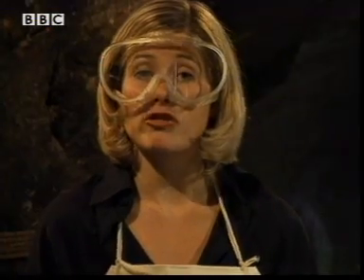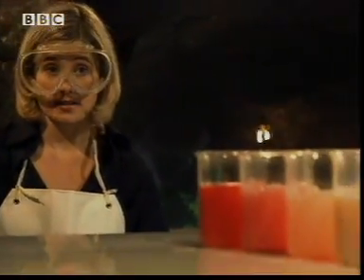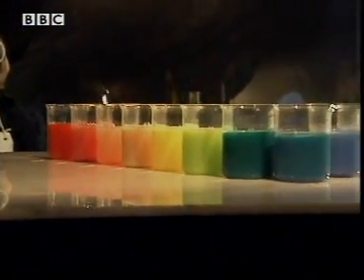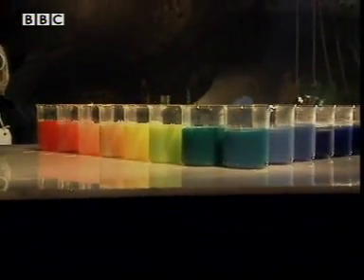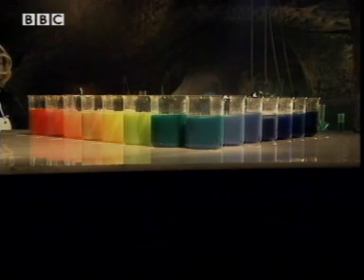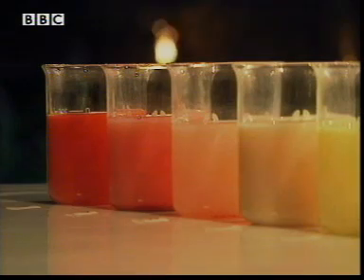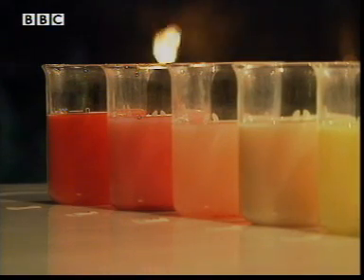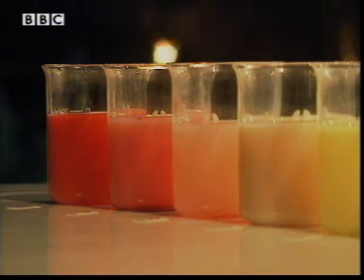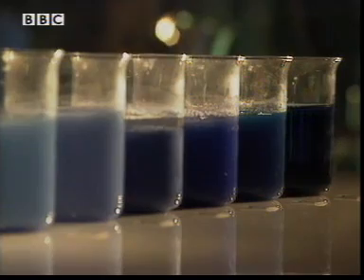Now, if I try these experiments on lots of different substances, I end up with all these colours, from the very red at one end to the very blue at the other end. But is the dark red — the very acidic — stronger than the dark blue, the very alkaline?